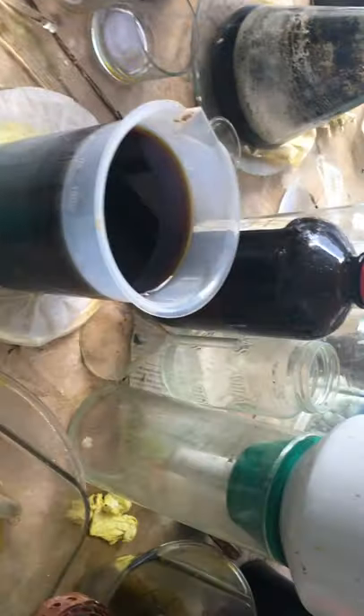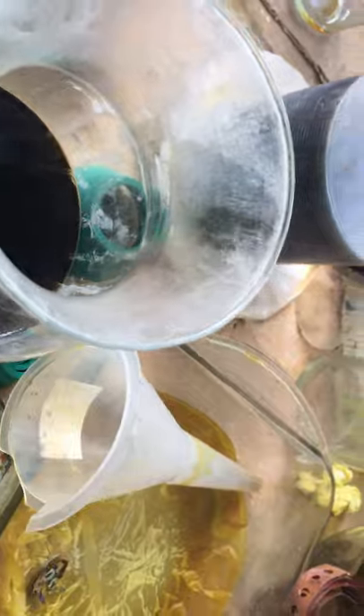Here is another — an ancient evaporation. After filtering, we have a... I don't know the next step. You can see the results.